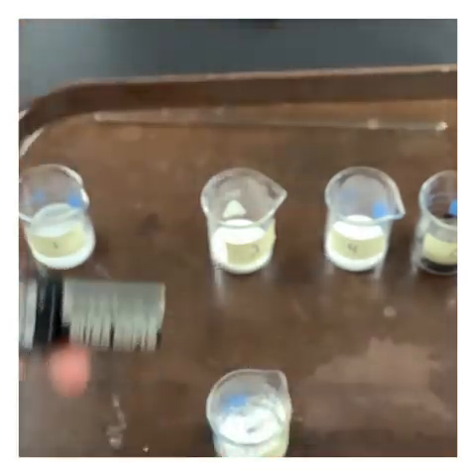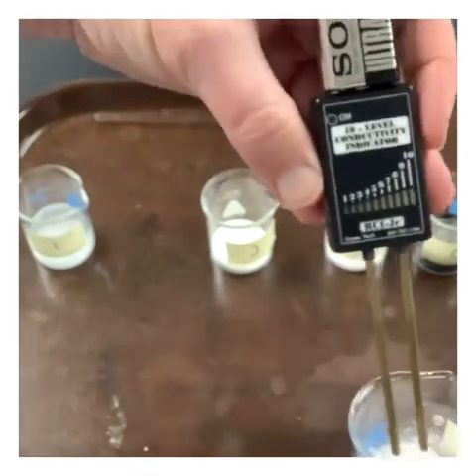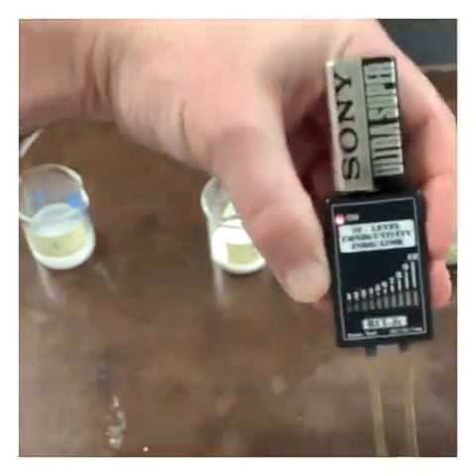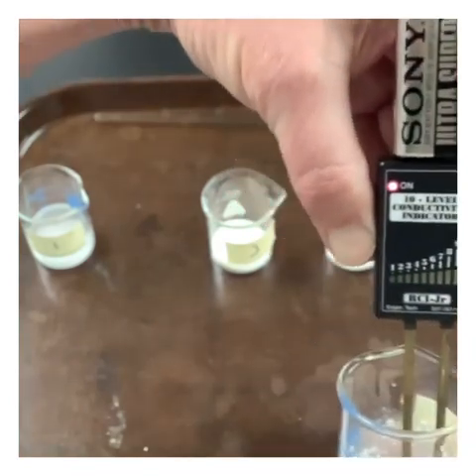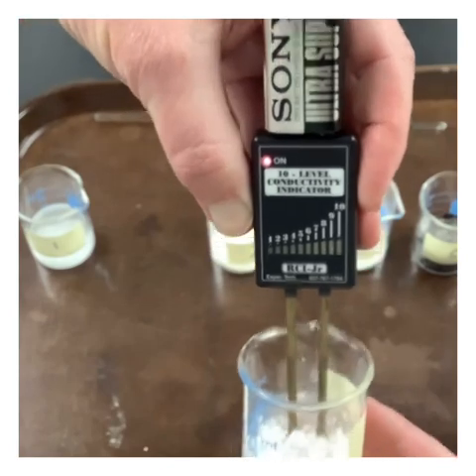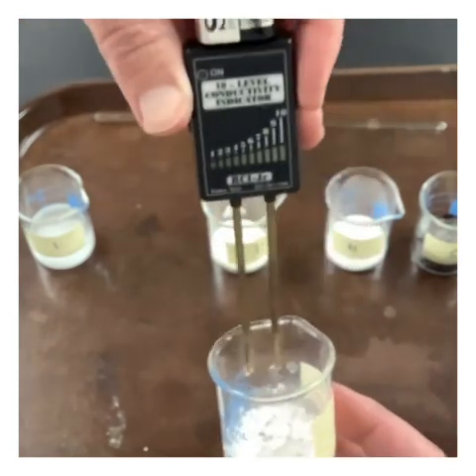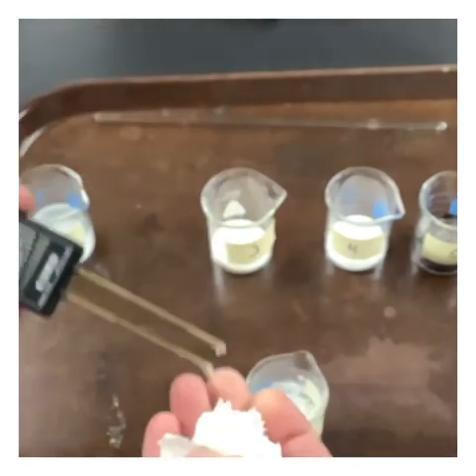And let's test our conductivity in water. So we've got our lights on. Let's see if we can get any conductivity. Doesn't look like we're getting any. All right.